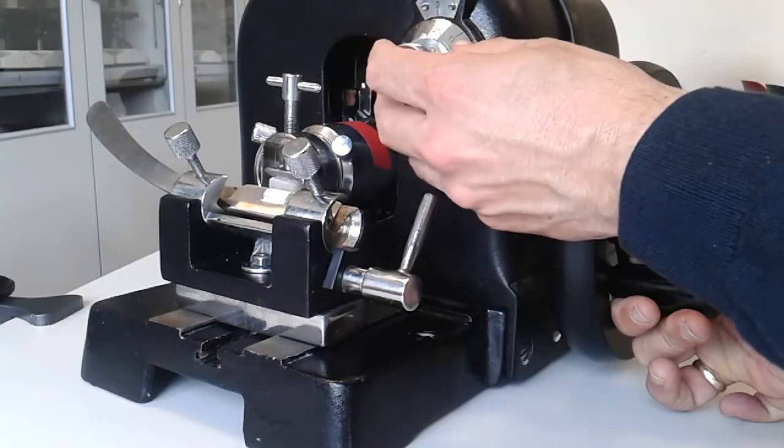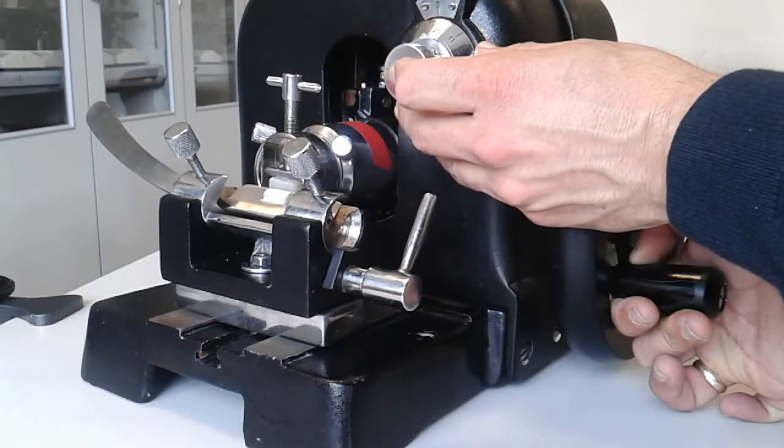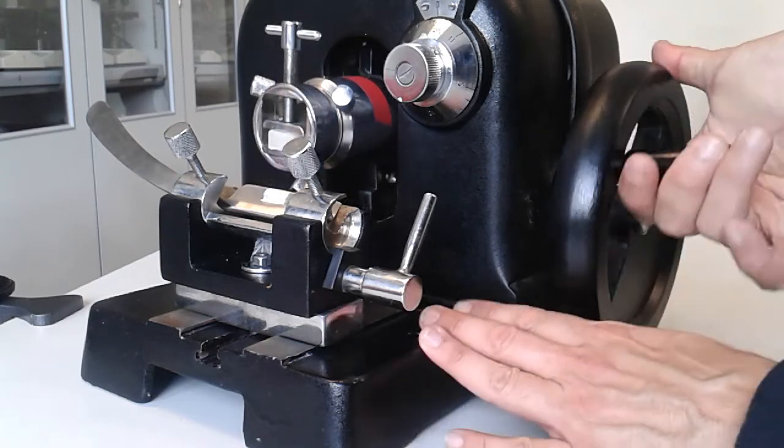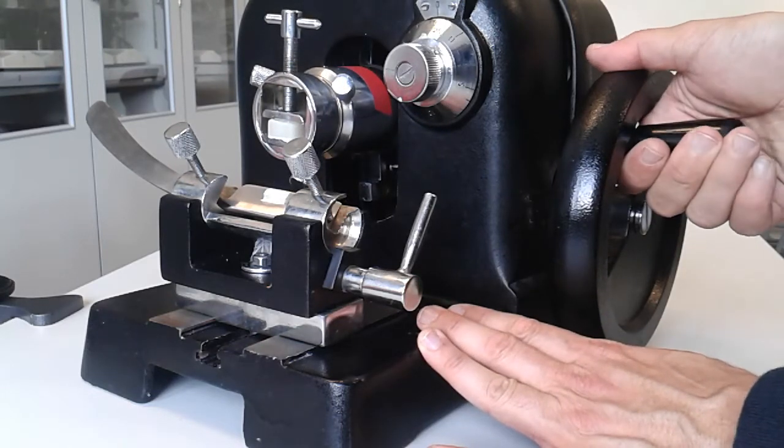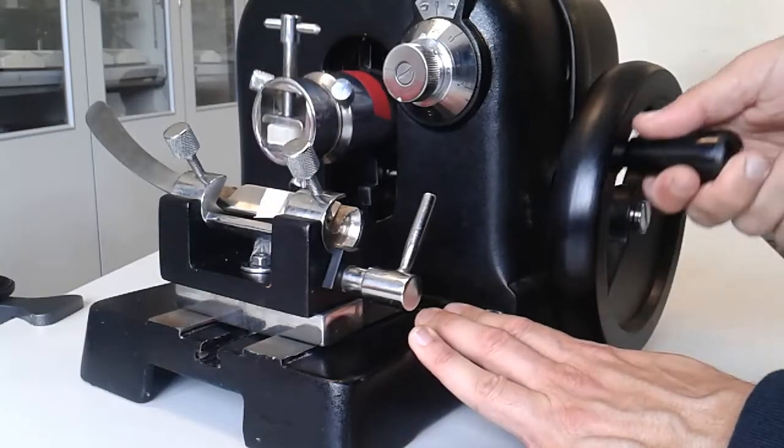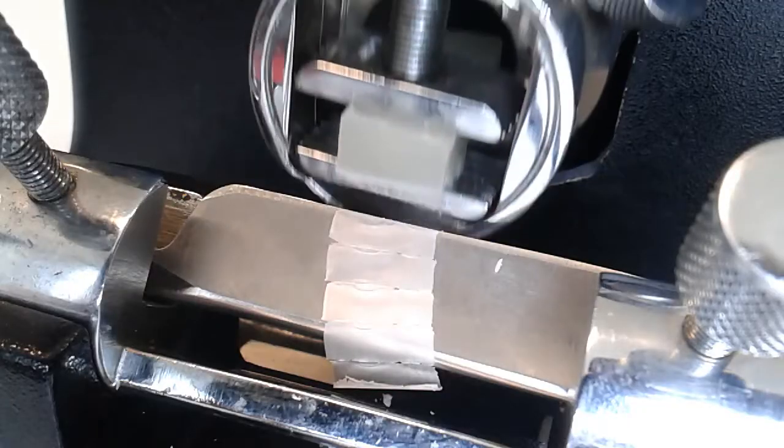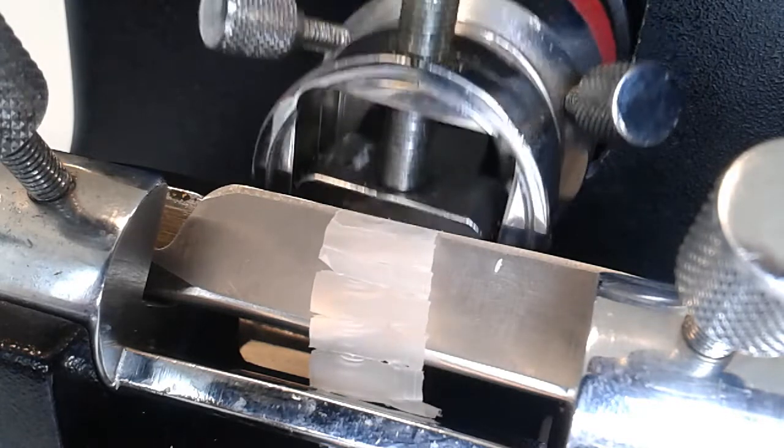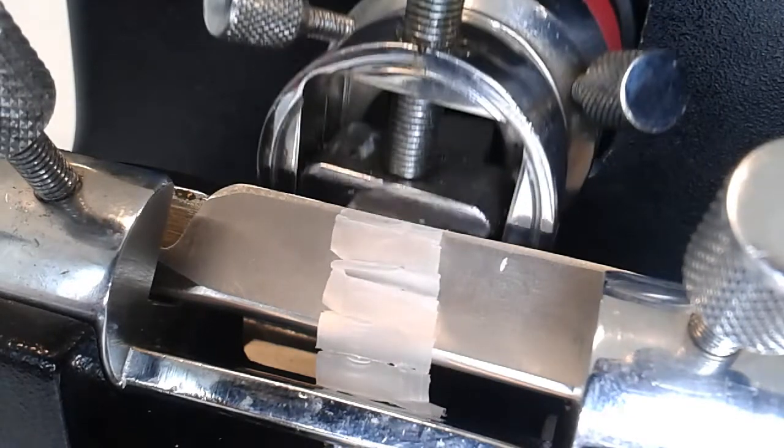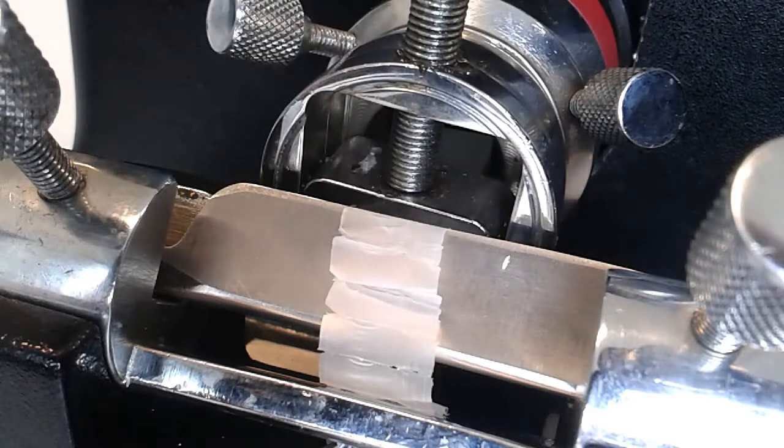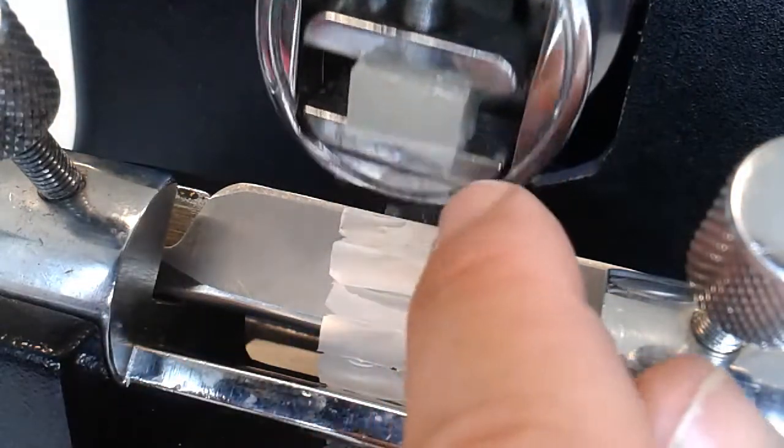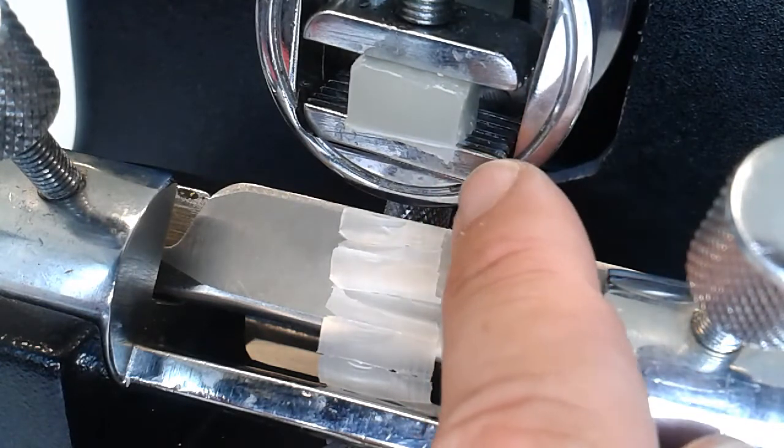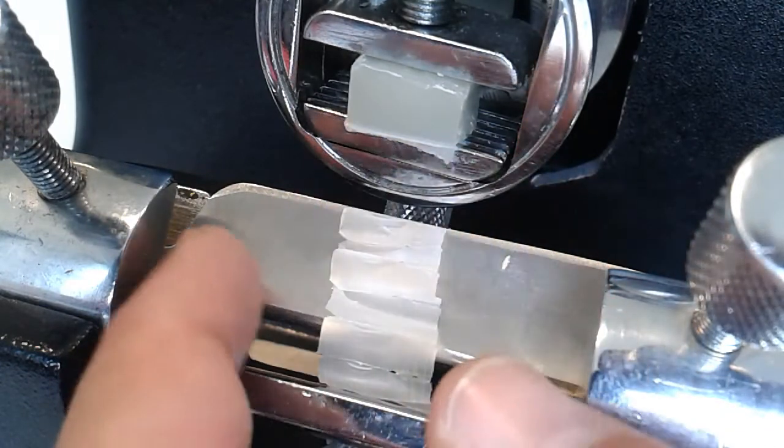Over here, this part is used to adjust the thickness of the specimen cut. I'm just going to rotate it a few times so that you can see it. Right now the paraffin block does not contain any specimen, it's simply only a sample to show you how the principle works.